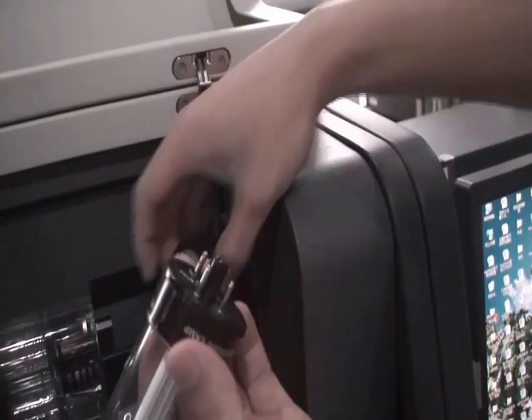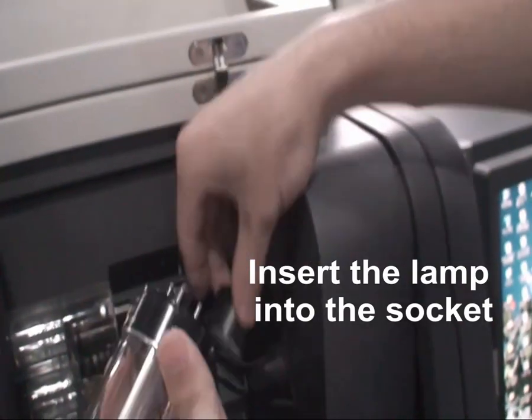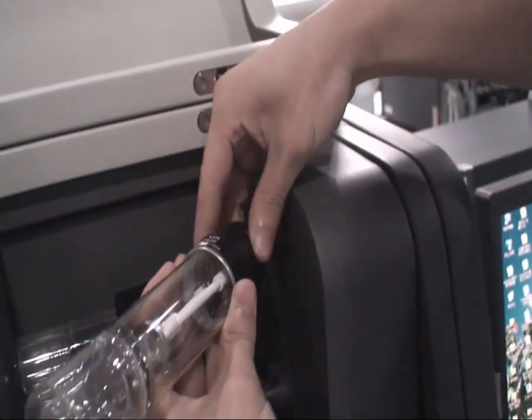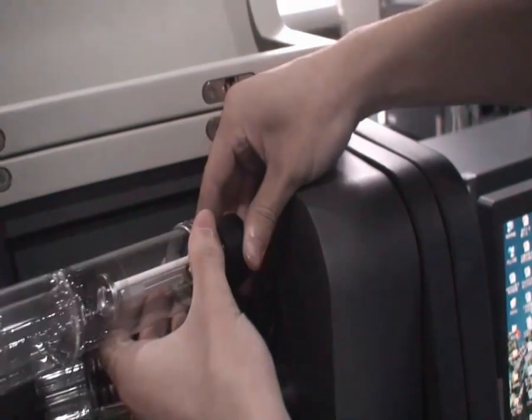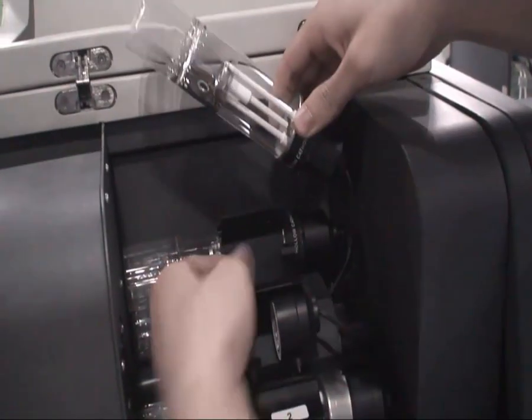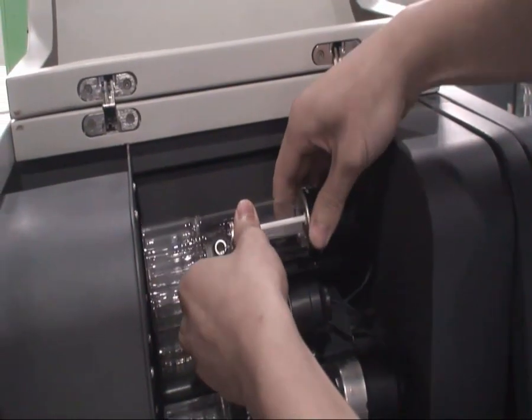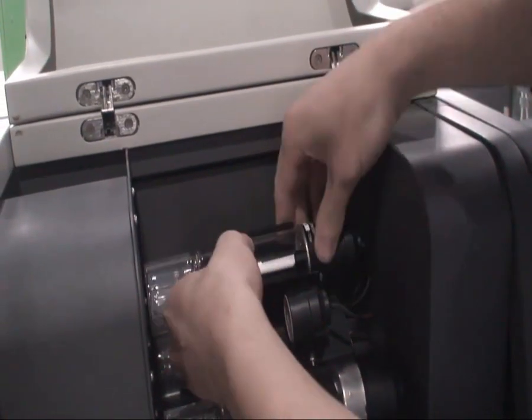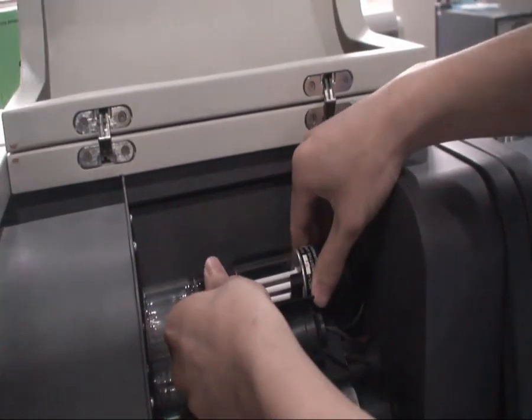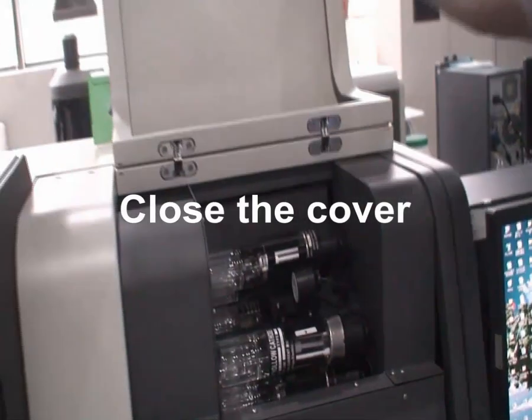First, install the hollow cathode lamp. Insert the lamp into the corresponding socket. During installation, be careful not to damage the lamp. Close the cover after installation.